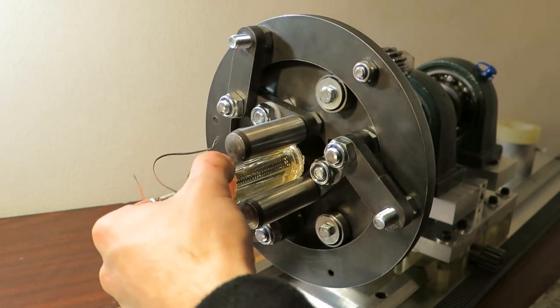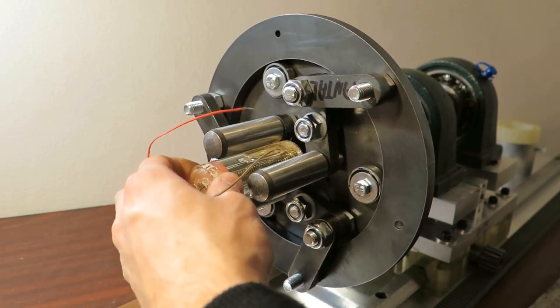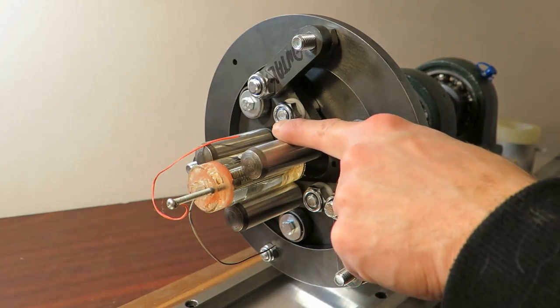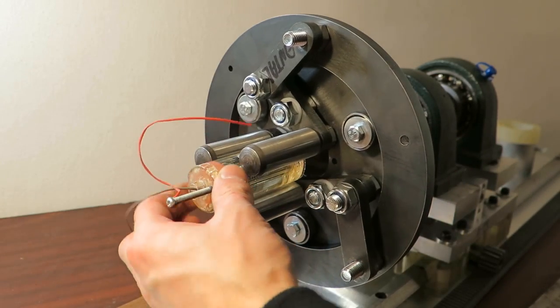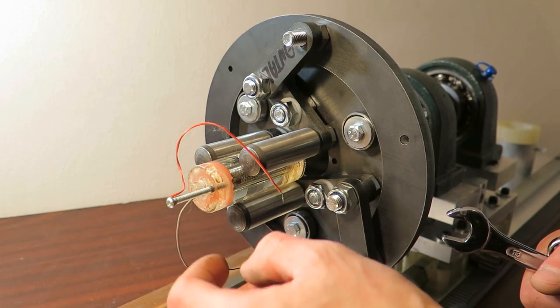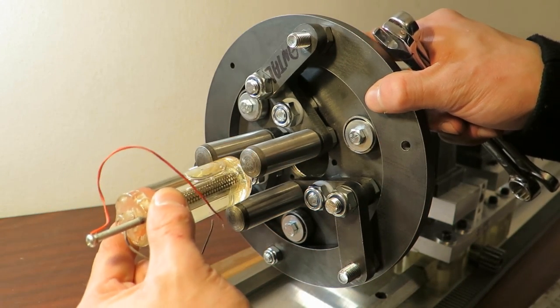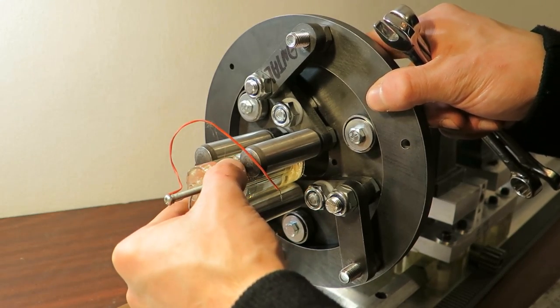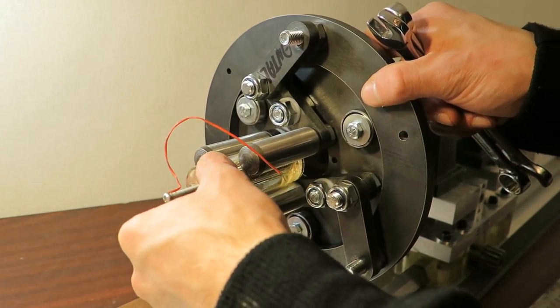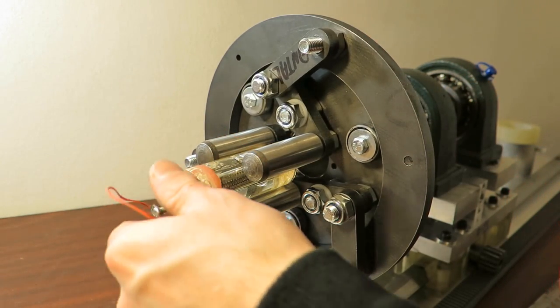Okay, so yeah, it can handle some torque. Well, that silicone coating will help a lot, and now it's gooey because there's some, what I put there, glycerol or something. Also, I can pull it off. Also can take some force.